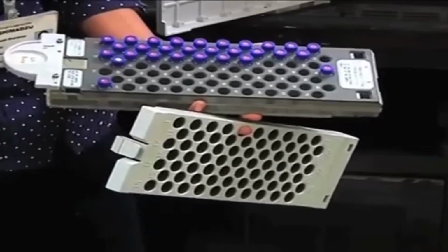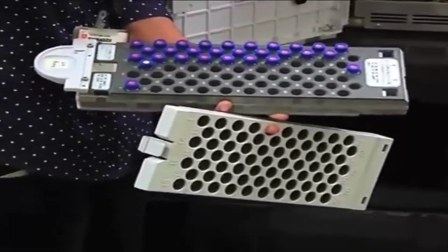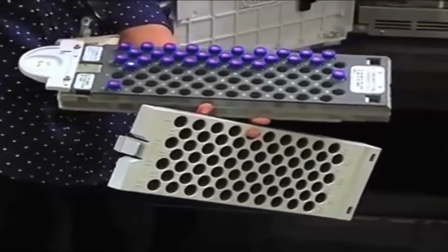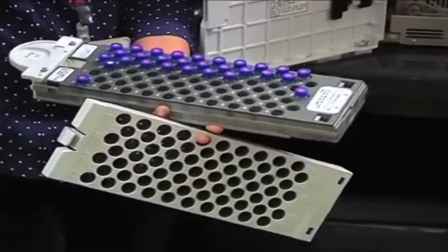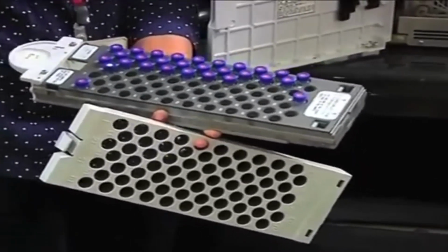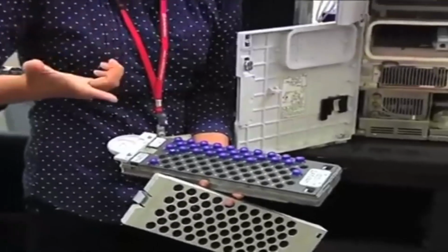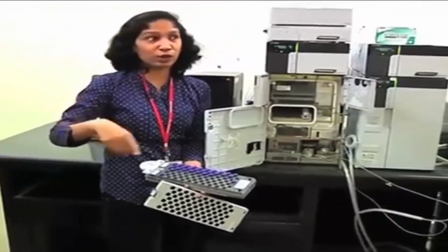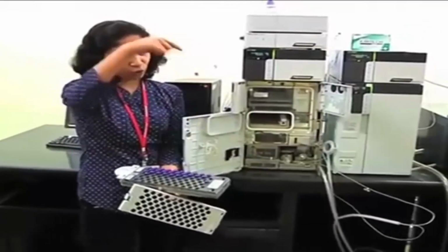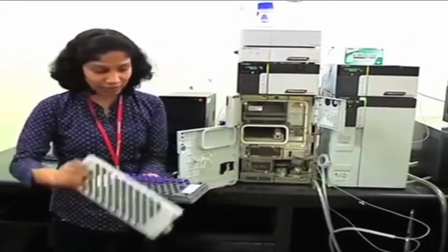So the outer surface of the needle is coming in contact with the sample. Now if that needle goes to the injection port and injects the sample, there is a possibility that whatever is stuck to its outer surface will get deposited on the injector port, and when you perform the next analysis, even if you are not injecting sample, if you are injecting only organic solvent or only water, the traces of those residues will pass and give you a response. That is called carryover.